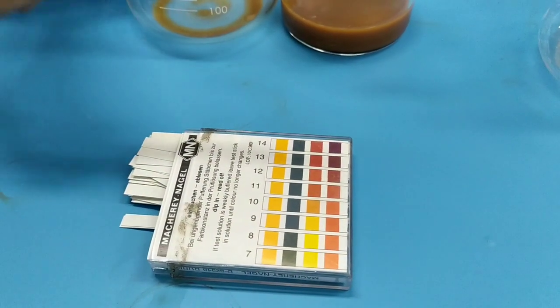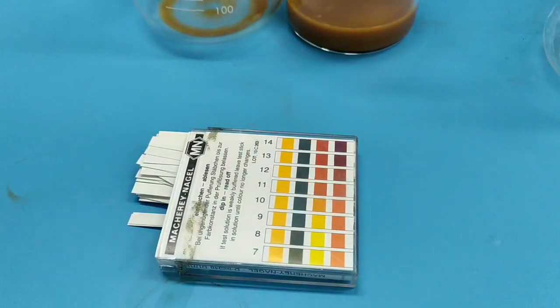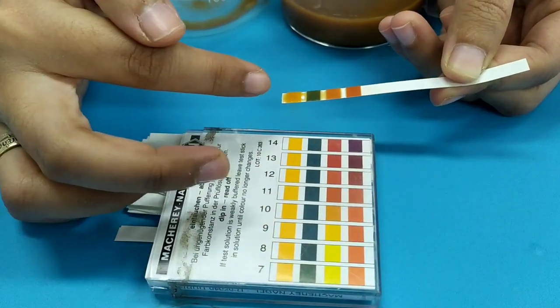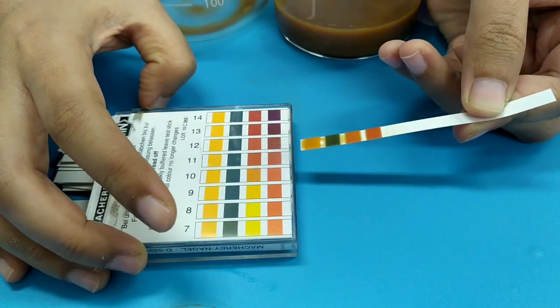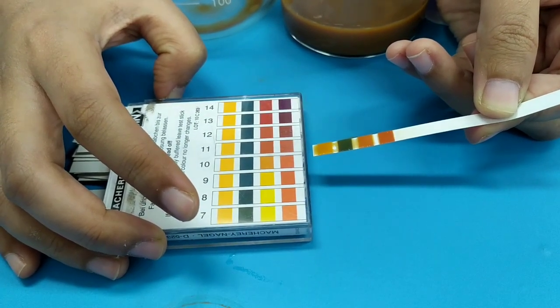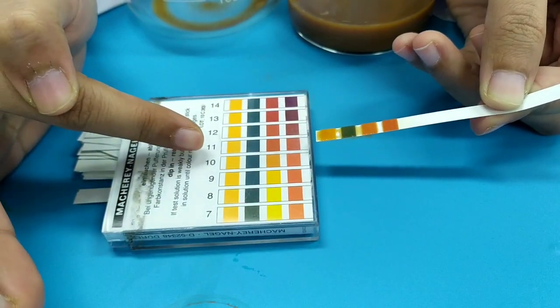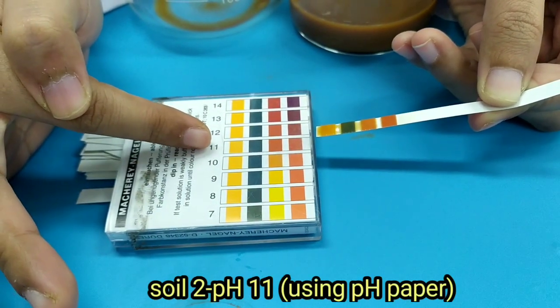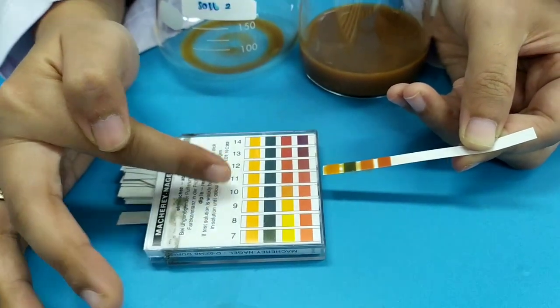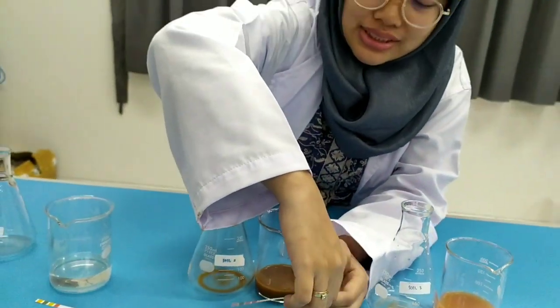Let's see the difference. It's near 10. Yeah, but the second box here is a little darker, so I think this is 11. Yeah, I think it's 11. So for soil number two, the pH is 11.